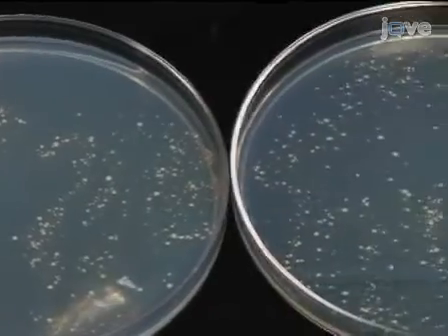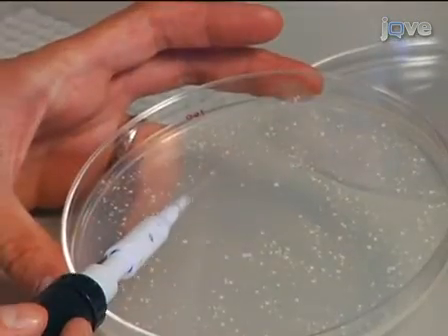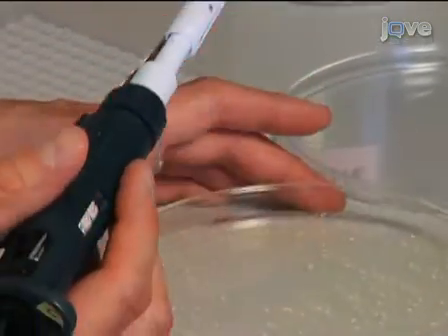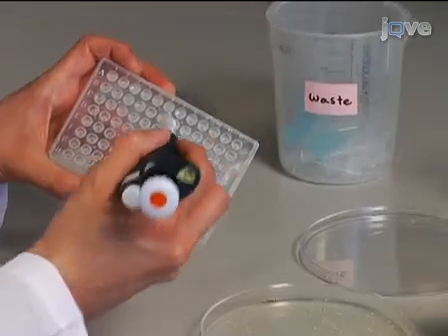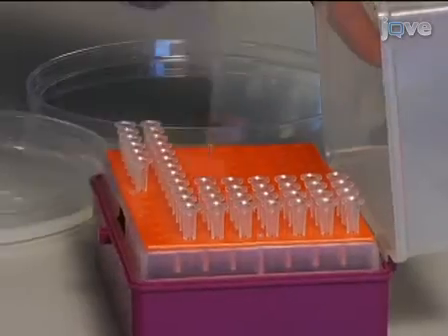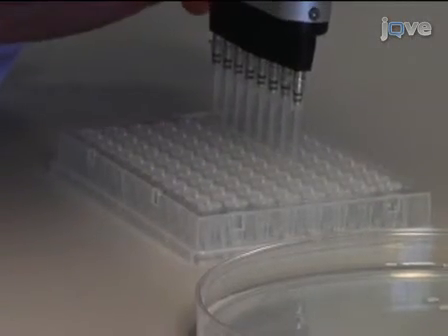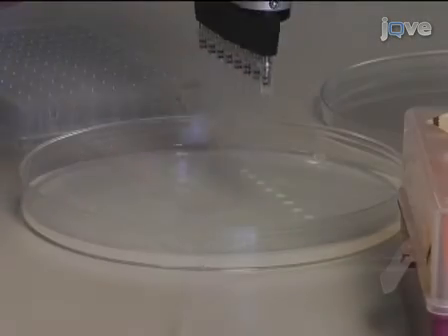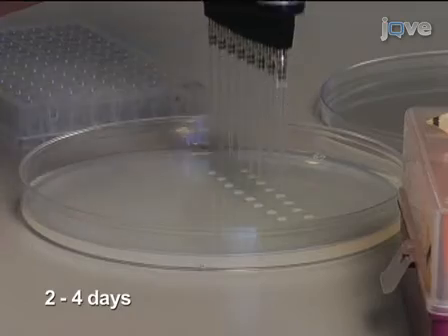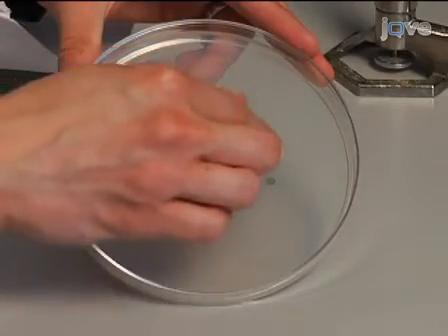Equally divide the remaining 4.8 milliliters of resuspended cells and plate onto large 150 millimeter plates and incubate at 30°C for three to four days. Once colonies have grown, resuspend single colonies — each representing cells containing a potential interacting bait-prey pair — in 100 microliters of 0.9% sodium chloride and plate 5 microliter aliquots onto selective media containing X-gal. Allow to grow for two to four days. Only colonies that display robust growth and a blue color are selected for further analysis.